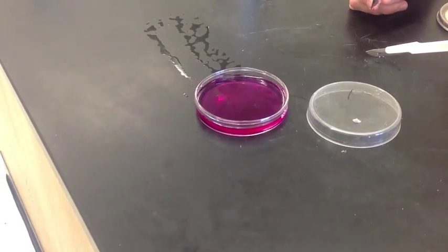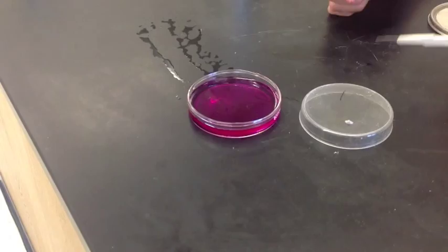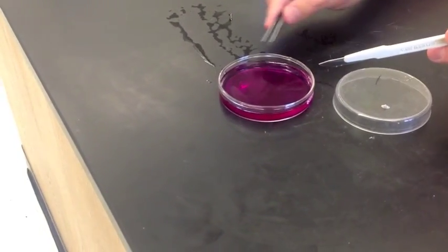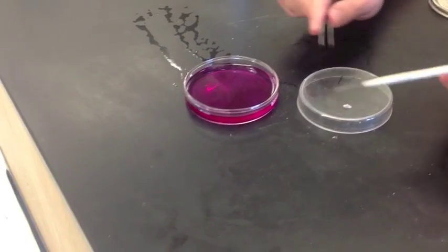Decided to go along the side, which is fine. Eventually, it'll completely go away. So we have ourselves a positive test. There's sodium hydroxide floating around in there because of the sodium reacting with the water.